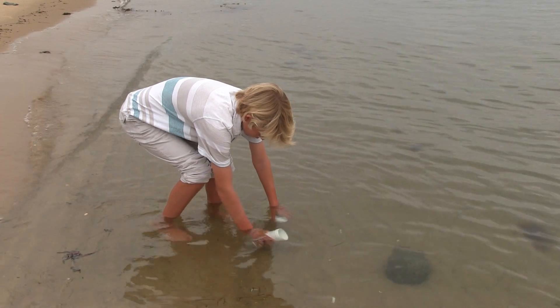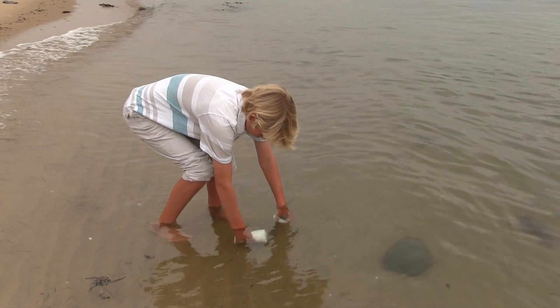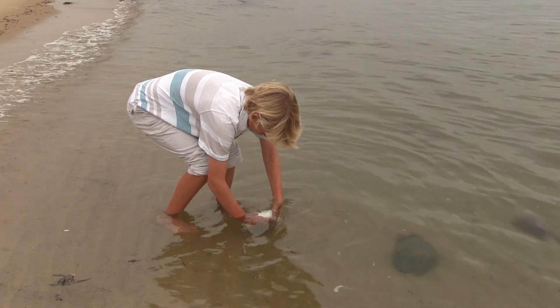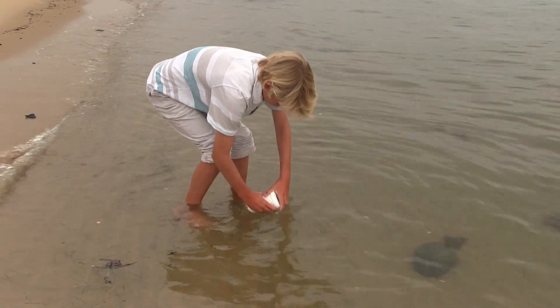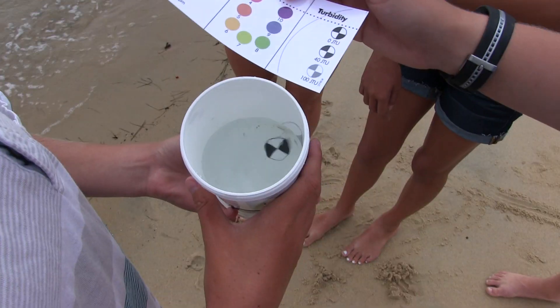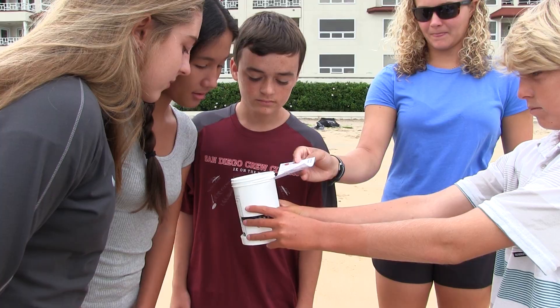To test turbidity, plunge the container below the surface. Turn the jar into the current and allow water to flow into the jar for 30 seconds. Cap the jar while still submerged. Be sure the water level is to the fill line. Hold the turbidity chart near the top of the jar, compare the Secchi disk icon in the jar to the chart, and record the result.